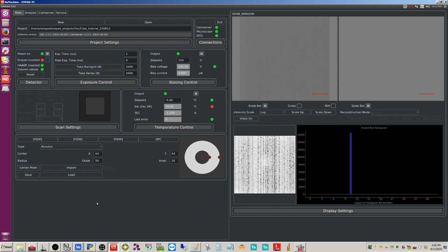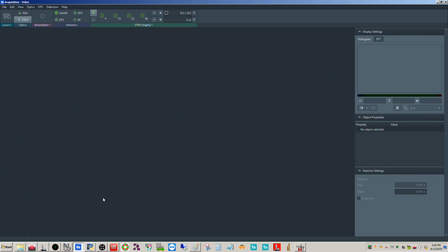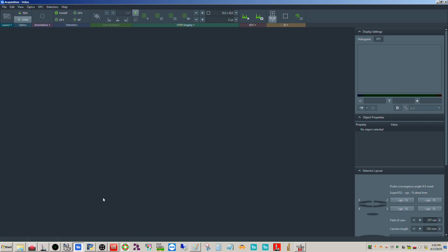viewing screen, right? So if we actually look at a diagram, it's going to make me restart Velox to show this. That's fine. We got time here. There's always success to be learned in failures.